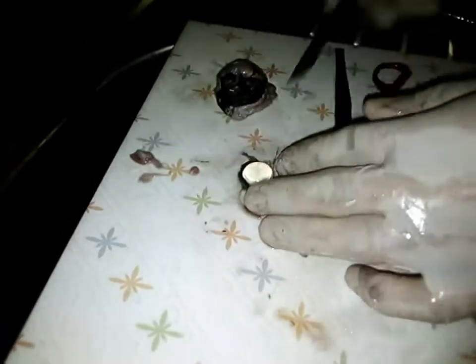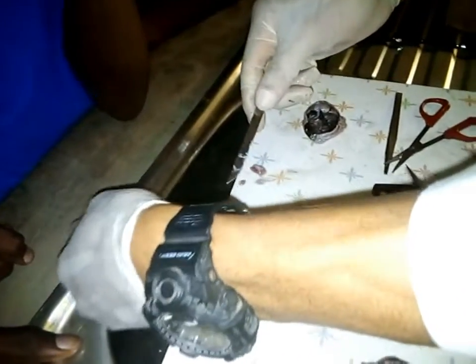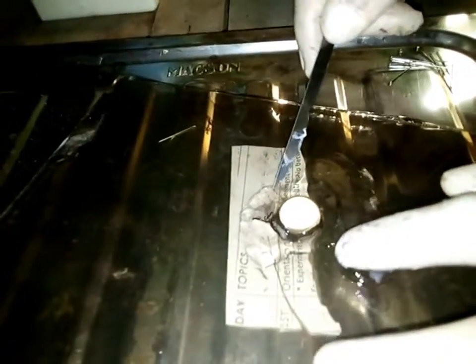Now you can as well place it here. Now come and look at this. Okay, now you can see the alphabet has been magnified. You can look at the camera to see it. Let me see. I'm not seeing it. Wait. You see it. So that is the function of the lens. Are you getting me? Yes.